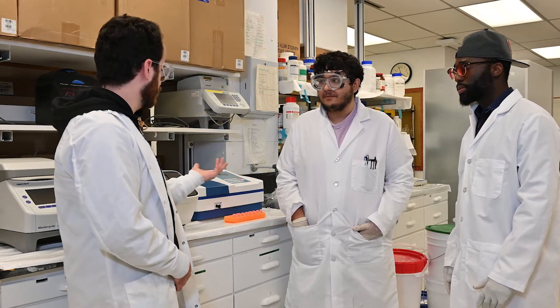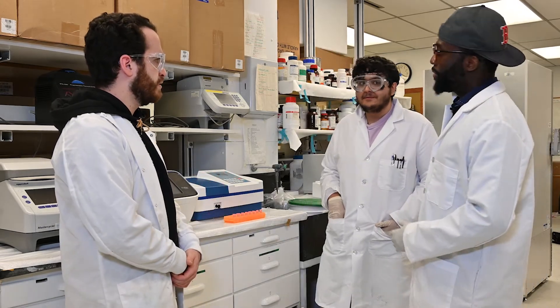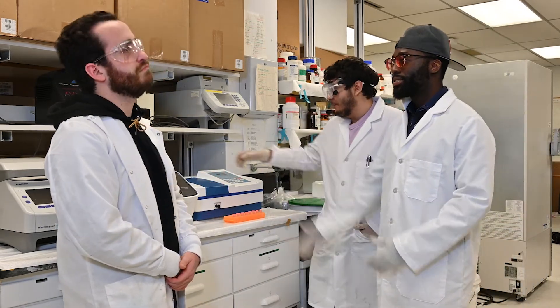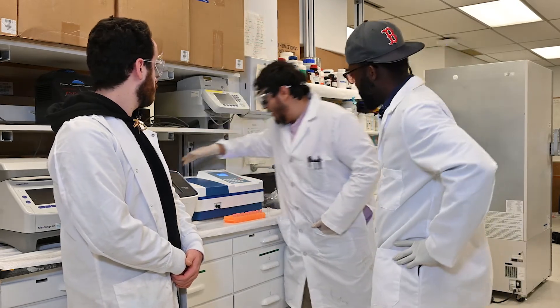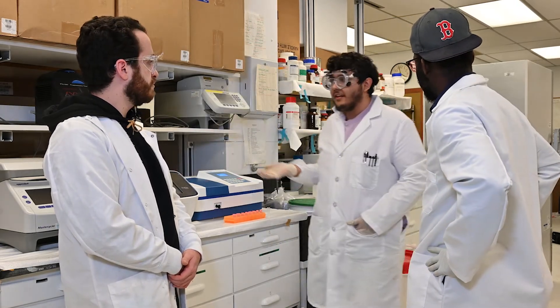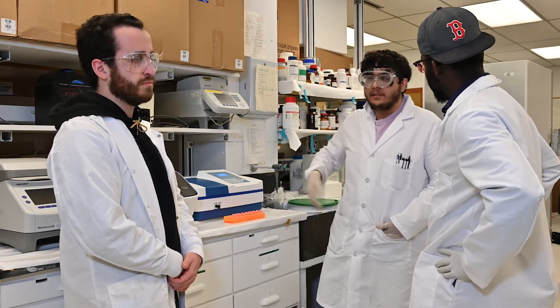But how do we use the spectrometer? Tony, you have to switch it on first. I think the switch is right here. So now that we've turned it on, we're just going to let it warm up a bit and calibrate it to the appropriate wavelength.